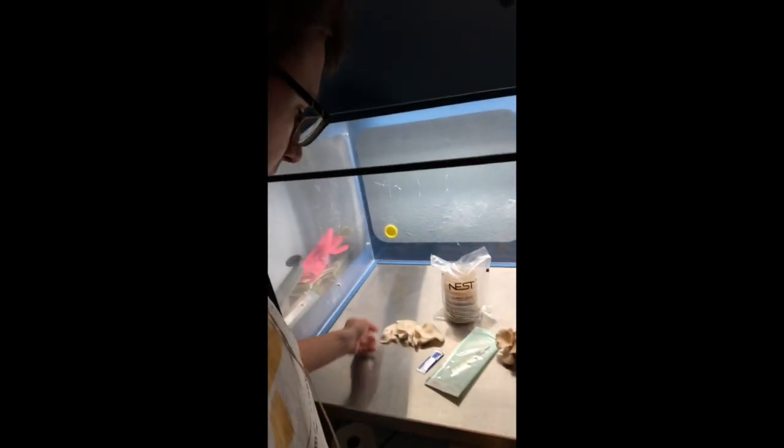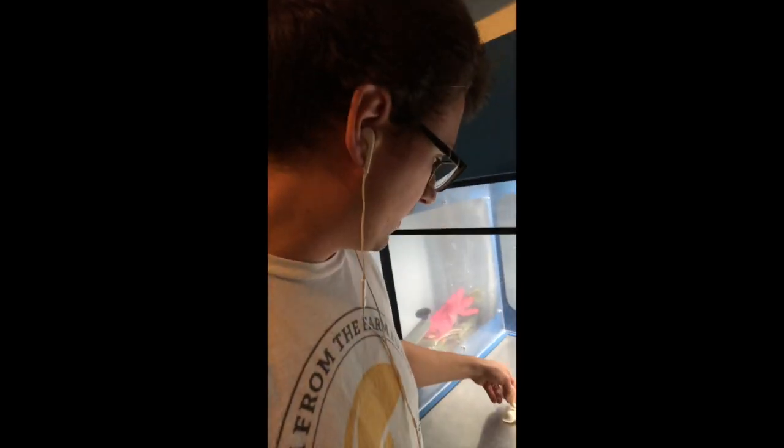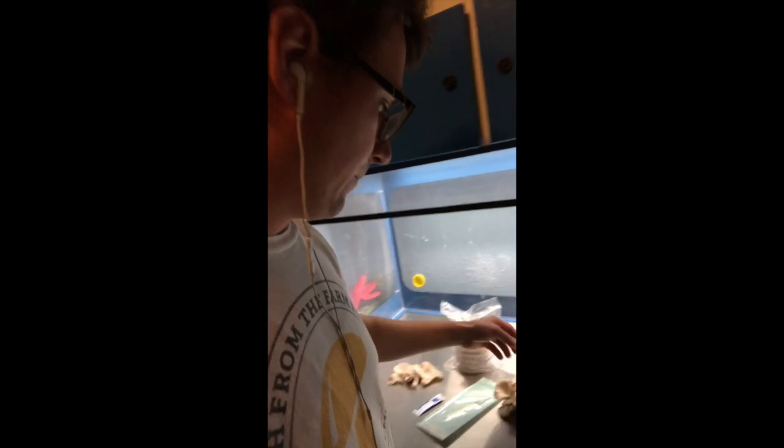There are definitely a few different phenotypes in this one block, so I'm going to clone this phenotype which seems to be a lot more what I was looking for — kind of like a delicate snow oyster variety. This is from an oyster found in Telluride during the mushroom festival, which I had cloned and took a spore print from, and then I tried to do some phenotype hunting.